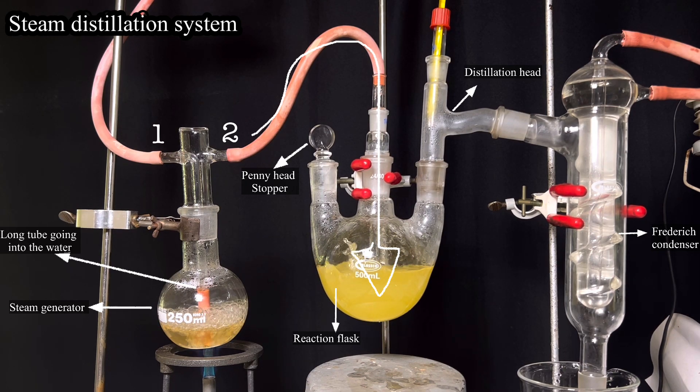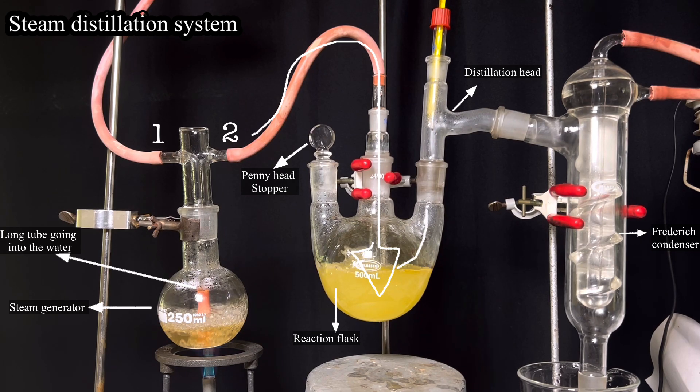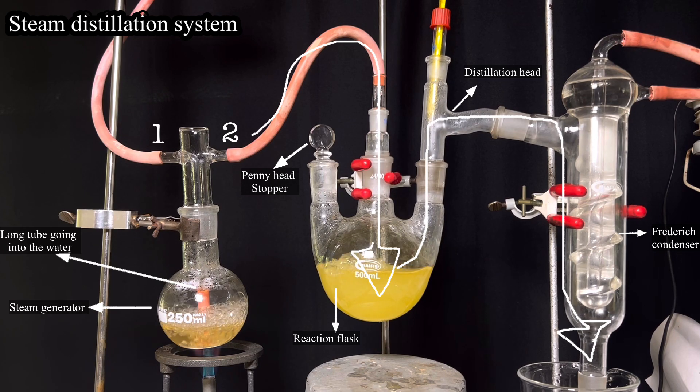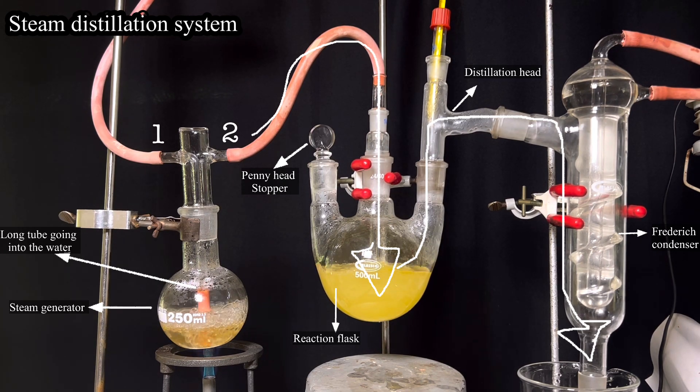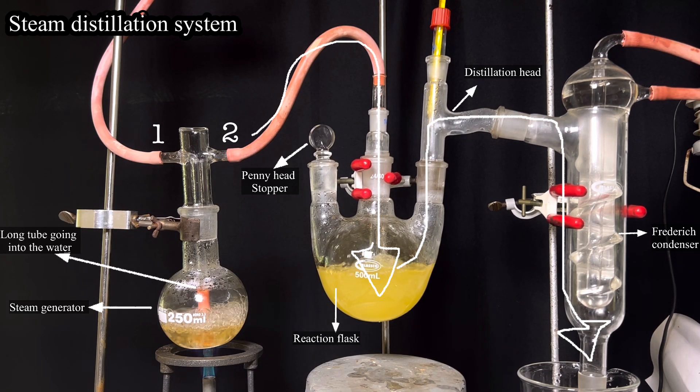When the hot steam gets bubbled through the reaction mixture, it heats up very quickly and the water carries the unreacted benzaldehyde with it. This could be easily noticed by the oily distillate that passes over into the condenser. Steam distillation was continued until all the oily droplets pass over.